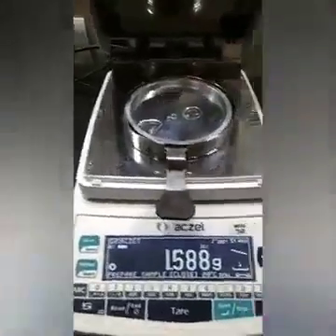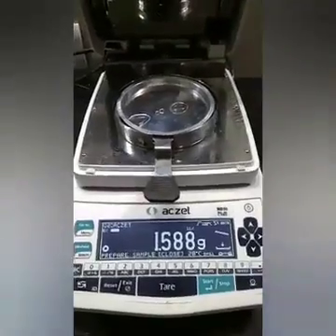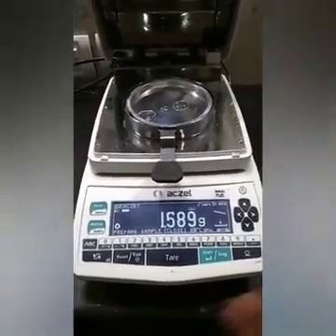If there is a solid particle, you have to spread it all around. Don't put it directly — spread it all over the pan. You should be spreading it evenly all over the pan.